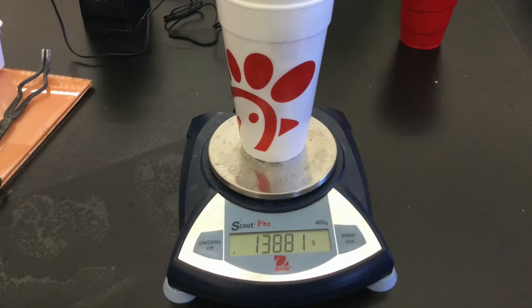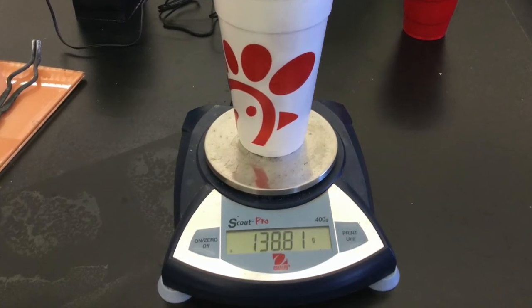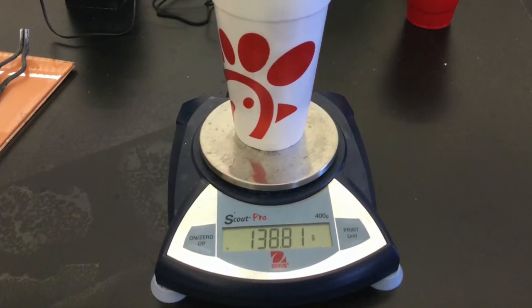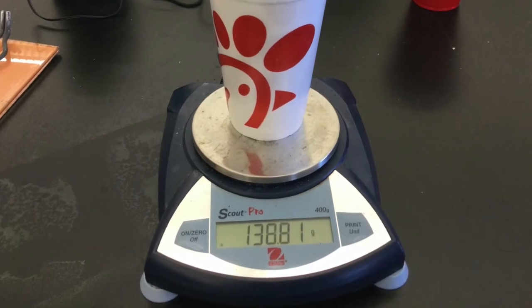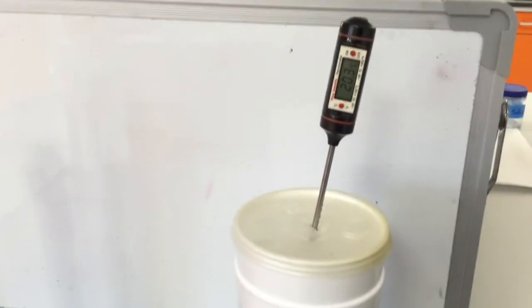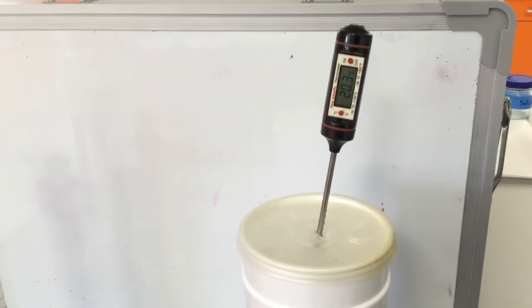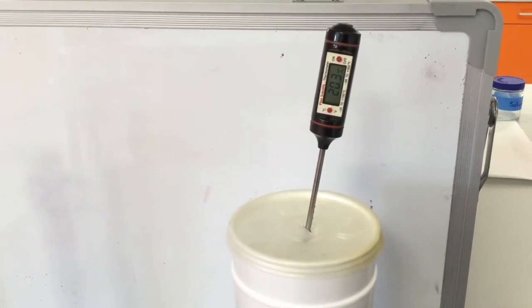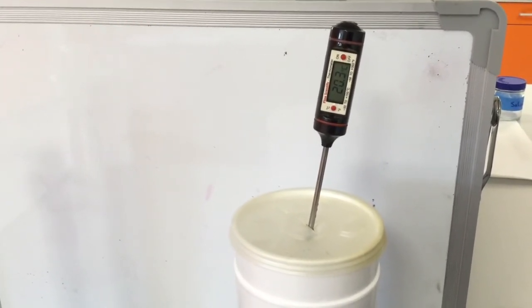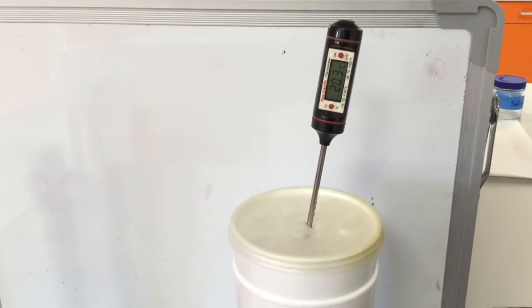For part two, begin by measuring 100 milliliters of hydrochloric acid into your clean, dry calorimeter and taking its mass. After your thermometer has had a chance to equilibrate with the hydrochloric acid that is in your cup, record the temperature.